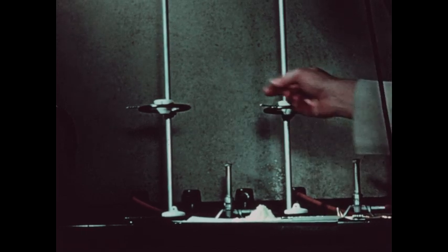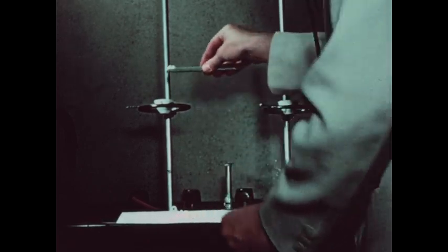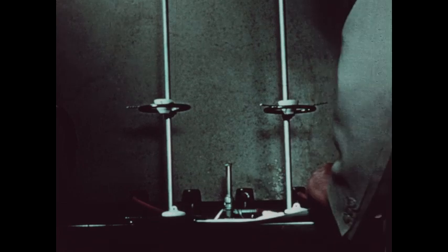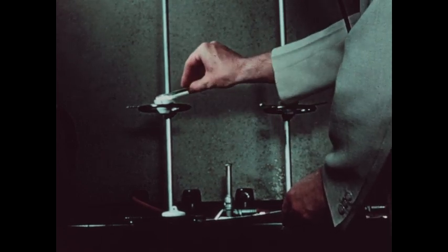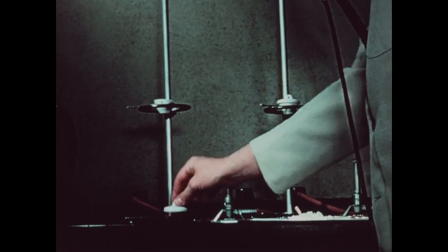The crucibles containing our weighed samples of copper have been placed on two triangles. We'll place quite a large excess of sulfur in each crucible, because any excess sulfur will simply vaporize and be driven off during heating. We want to make sure we have enough sulfur to react with all of the copper. After charging both crucibles with sulfur and placing the lids on, we'll heat for about 10 minutes — long enough to ensure all excess sulfur has been driven off. Then we'll cool the crucibles and weigh them.